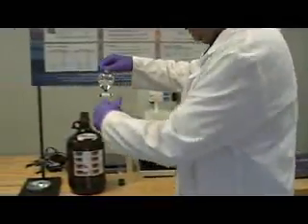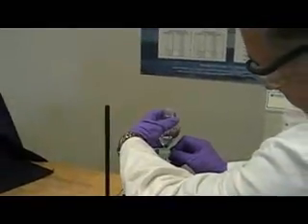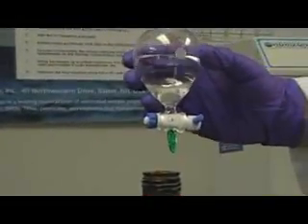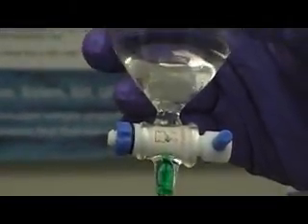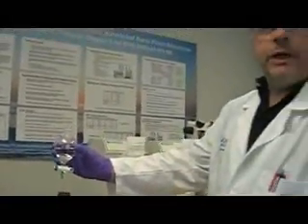So the first step is to decant this from the separatory funnel. And I do this simply by going over to the waste beaker and slowly decanting the green food coloring. Now the green food coloring makes it much easier to see, so your end point is normally about where you see a small line above the stopcock. Okay? Now the next step is then to pour this off into an evaporation pan that's already been pre-weighed and placed on your SpeedVap 3 evaporation system.